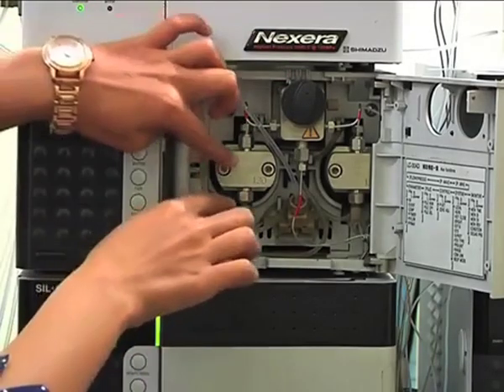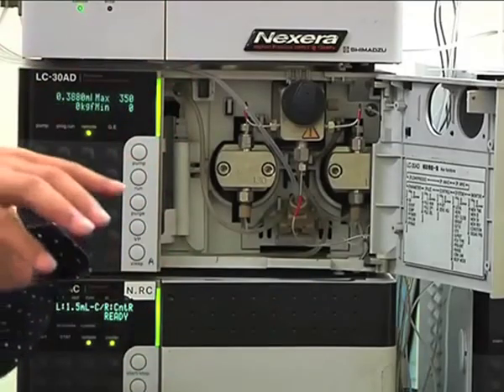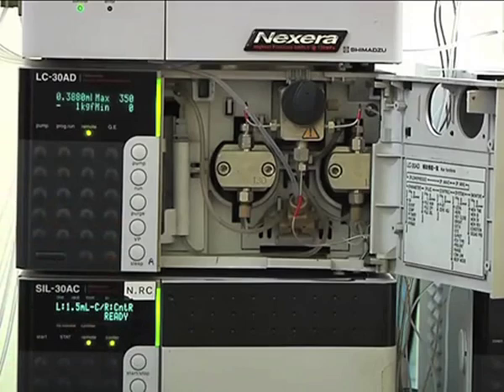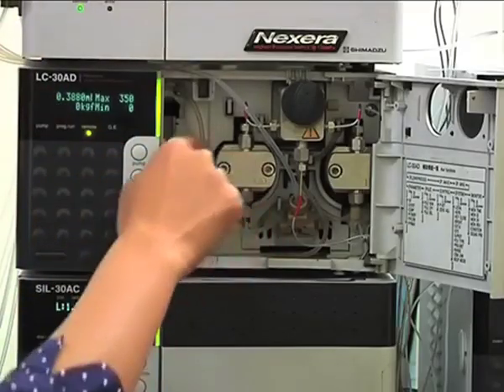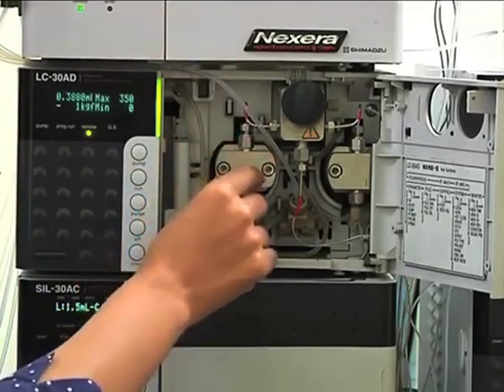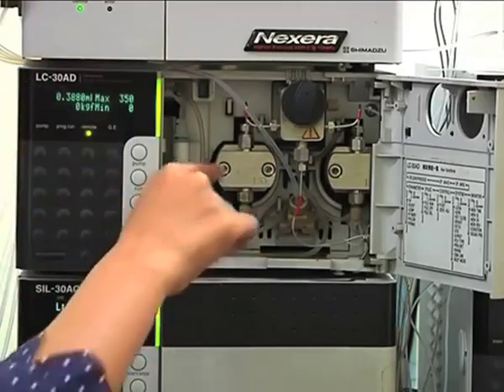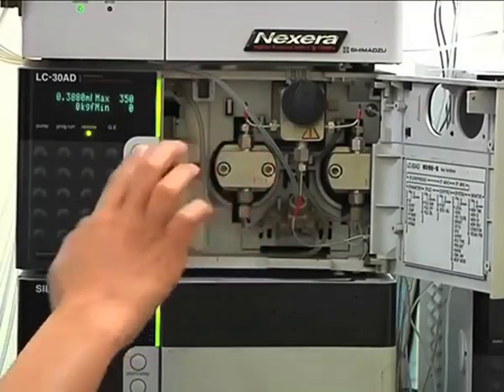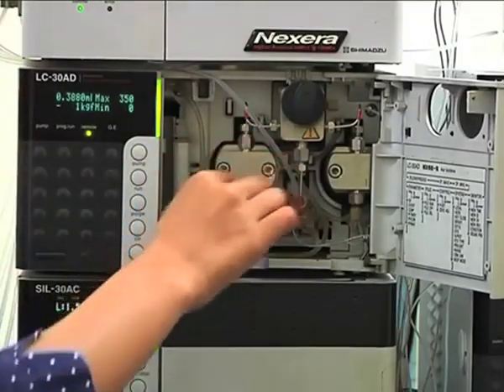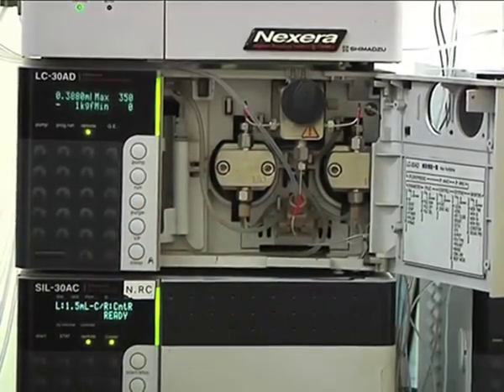If both ends are open at the same time, half of the flow might go this way and half might go the other way. We don't want this scenario. Initially this valve will open, mobile phase will fill in, then this will get closed. Now the plunger will move and pass mobile phase to the column, and at that time this valve is open. After the mobile phase in this plunger unit is over, it has to do a refilling action.